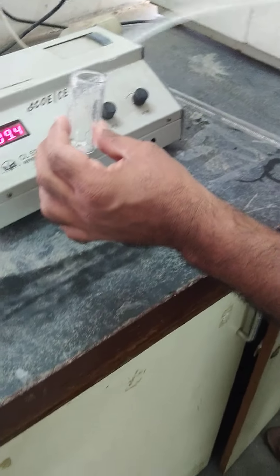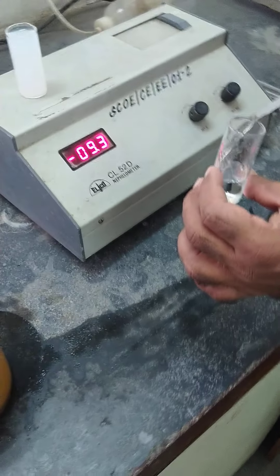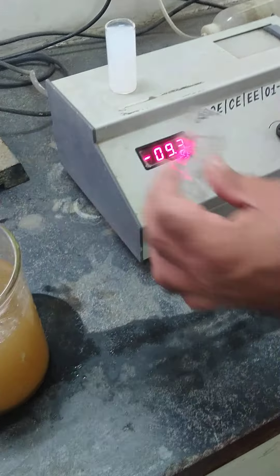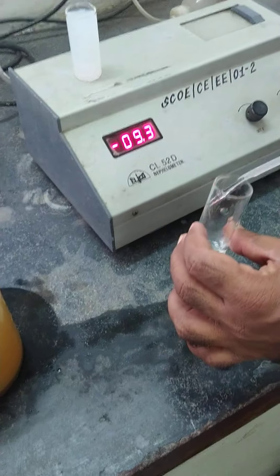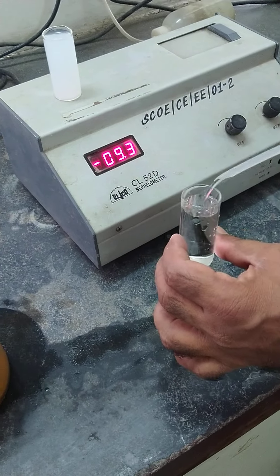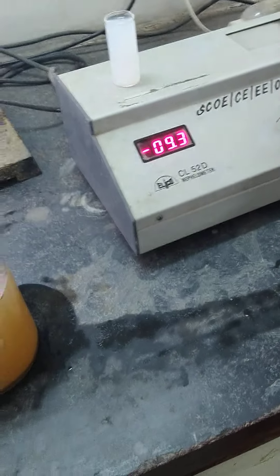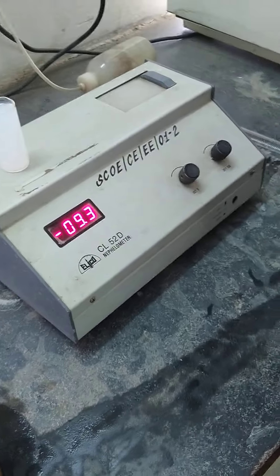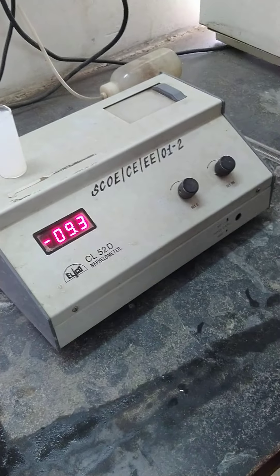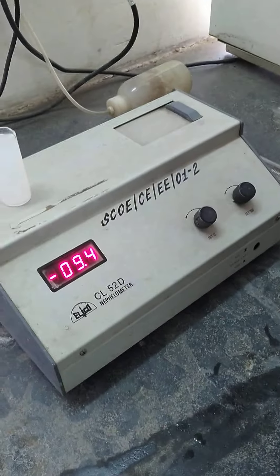We are starting with the turbidity experiment. For that we have used the instrument called a nephelometer. This nephelometer also needs to be calibrated, so for that we are using two solutions — first, of course, the distilled water.